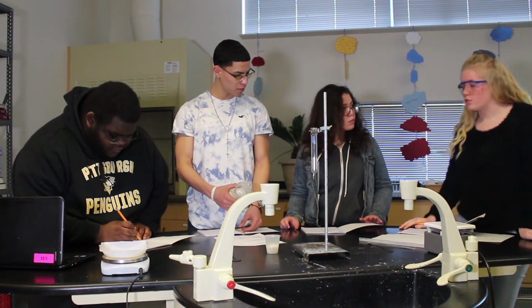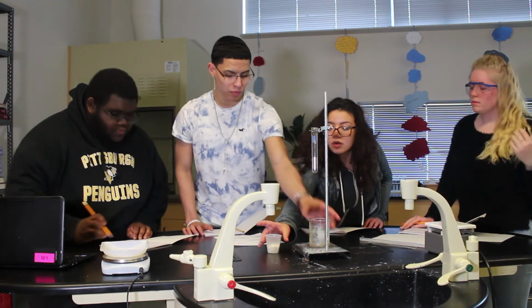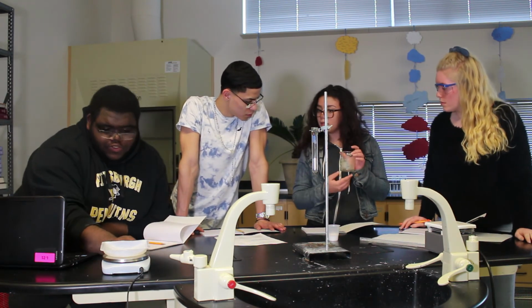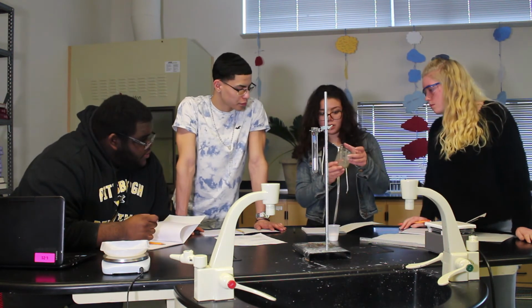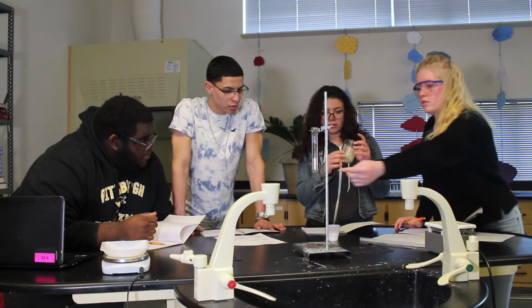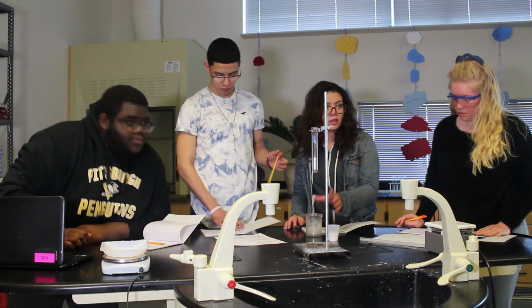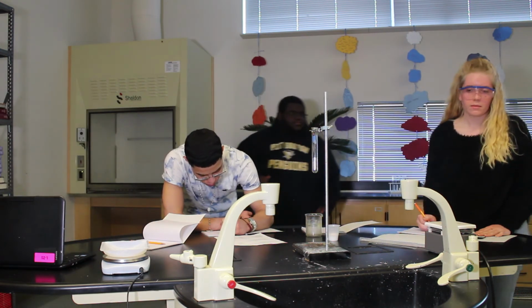Should we write out a procedure first? Yeah, probably. So we have to figure out how much we're going to use of the chemical and how much water we're going to put into the beaker. Okay. So what do you want to use for it to submerge completely? You can do like 100 milliliters of water. Yeah. Oh, is the beaker clean? Well, if the chemical is in here, it doesn't really matter that much. Yeah, that's true. So 100 milliliters of water. Oh, I know what we need. We need to grab the units in there. Yeah, we got that now.